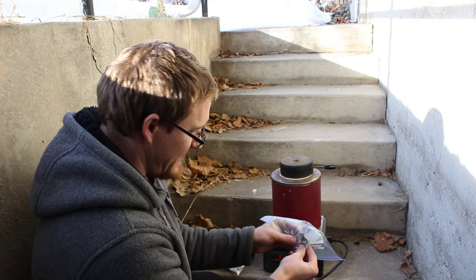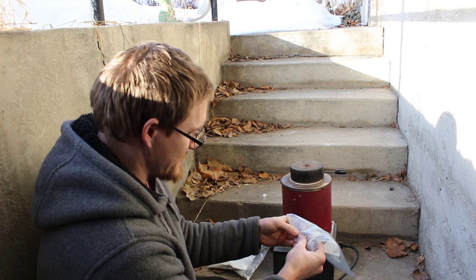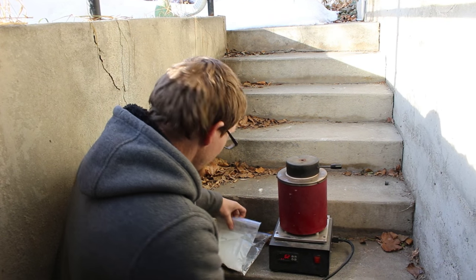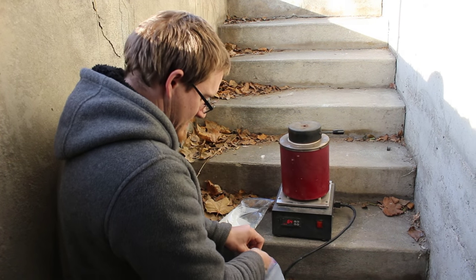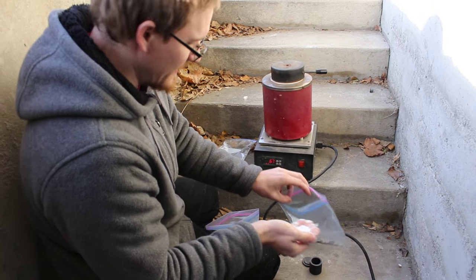Okay, so here's the lead paint. I've kind of been crushing it up a little bit. It's sort of flexible so it's a little bit difficult to crush but shouldn't be that big of a problem. So I'm going to mix it with flux. So I have some borax here. I'm going to mix in a little bit of this to help make the material runnier and the lead droplets that form fall out of solution.